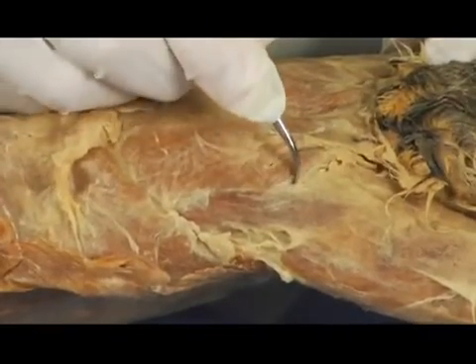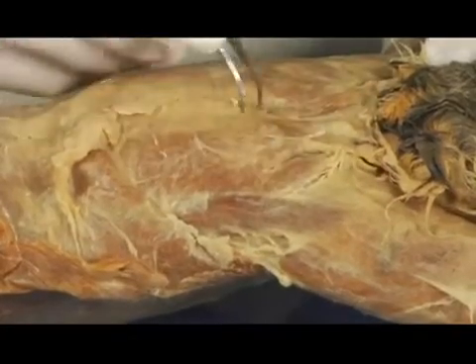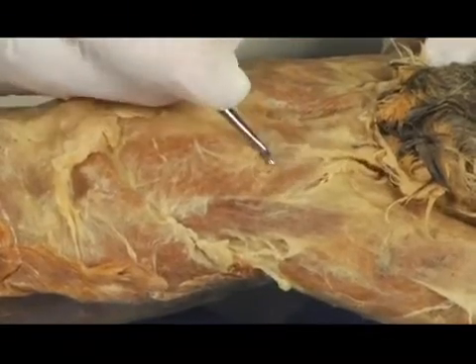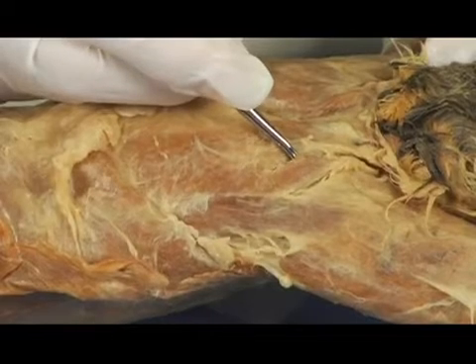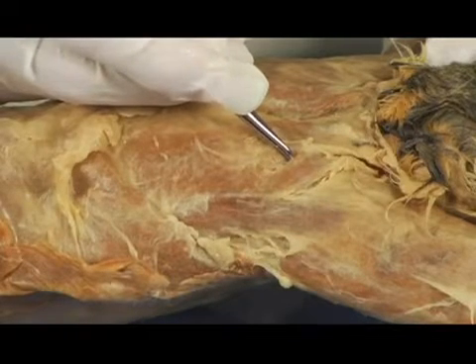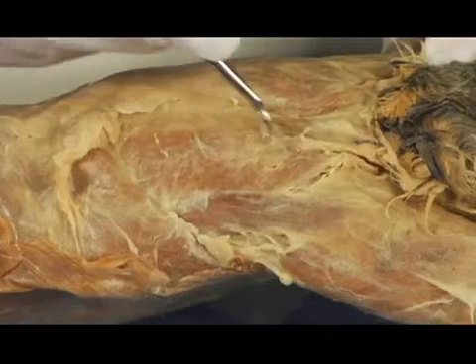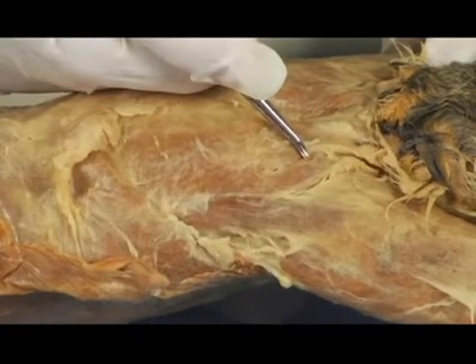And I can do the same on this side. Remove a little bit more tissue. I think you can see that right there. Okay, so there's a muscle, small, yep, but it's visible. This is something that's called the levator scapulae ventralis, okay? And basically what that does is it lifts the scapula, or levates the scapula. And so the scapula is in this area, and there's the levator scapulae ventralis right there, okay?